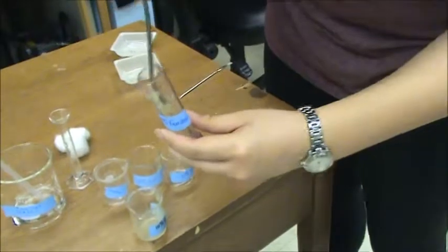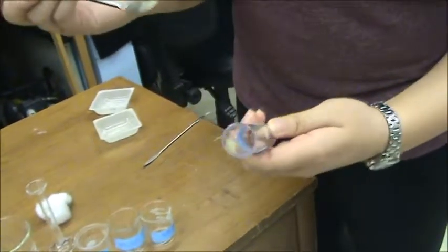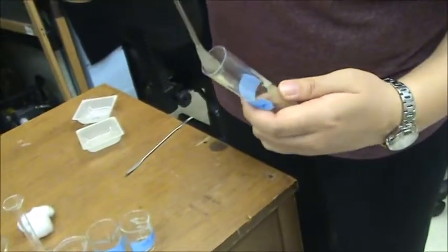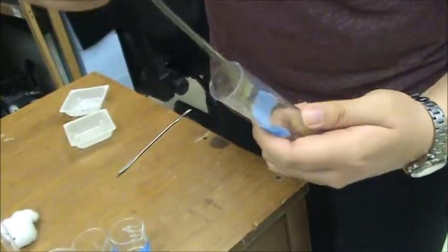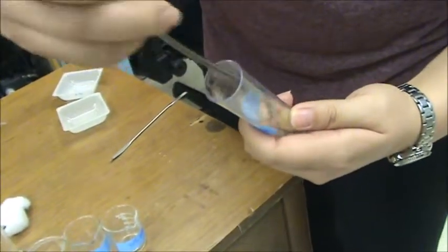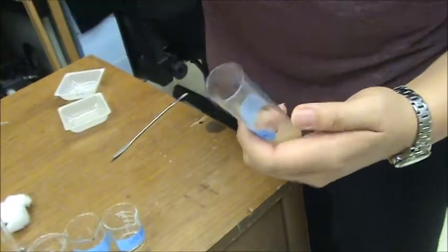However, the flies do stick to the food. So all the food on the side, you want to push it down as far in as you can so that the flies don't get stuck. And there you go.